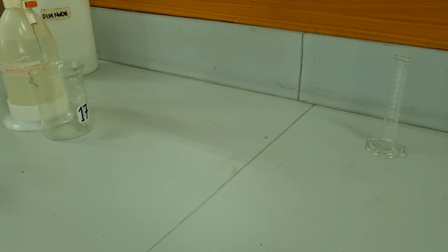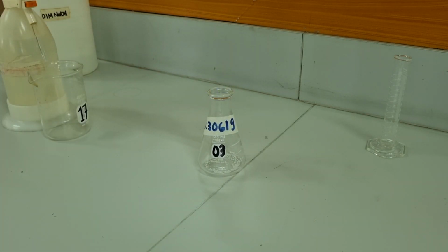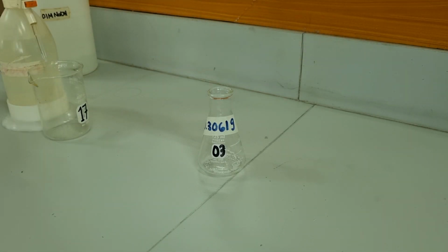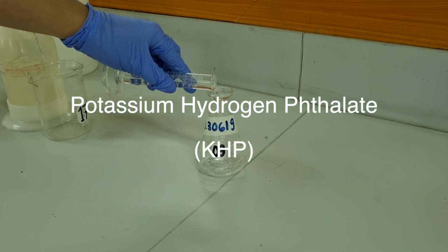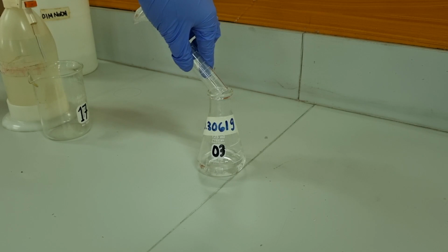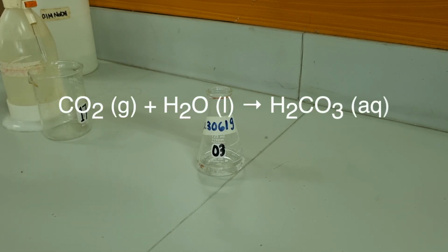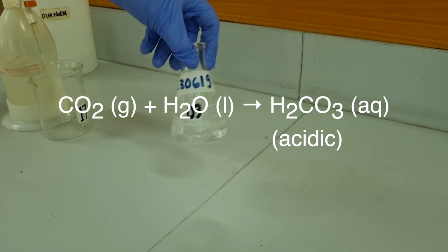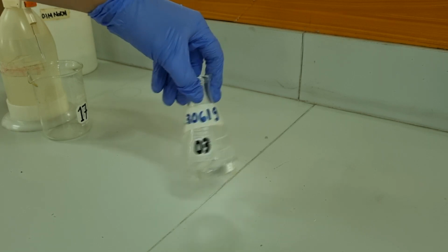Since I have my base as my titrant, or the solution I'm adding volumetrically, I need to have my acid in an Erlenmeyer flask. I accurately weighed here potassium hydrogen phthalate or KHP. I'm adding some cooled boiled distilled water to dissolve the solid, and I'm mixing it. I boiled the water first to remove carbon dioxide, which makes water acidic. Since I only want my base to react with KHP, I had to remove the carbon dioxide.